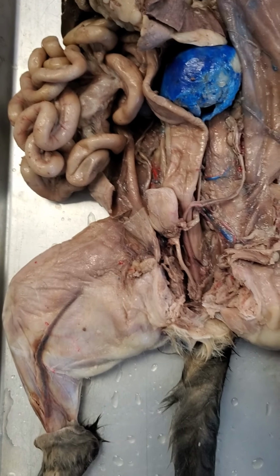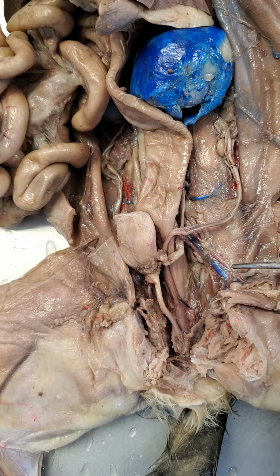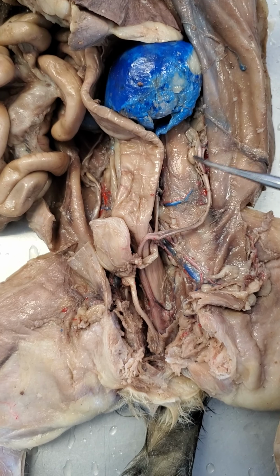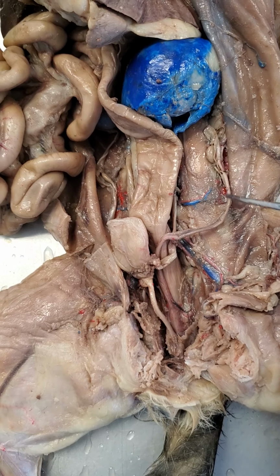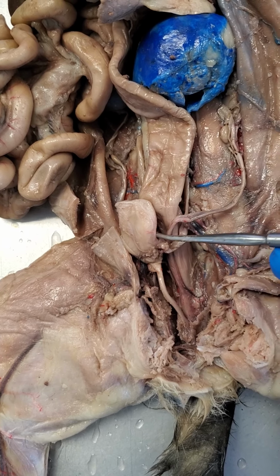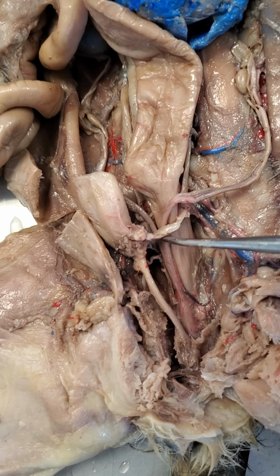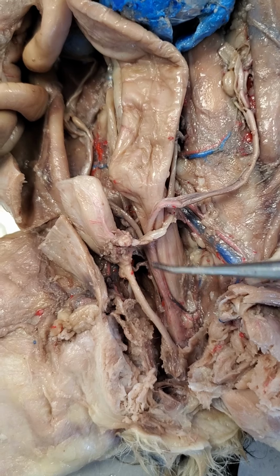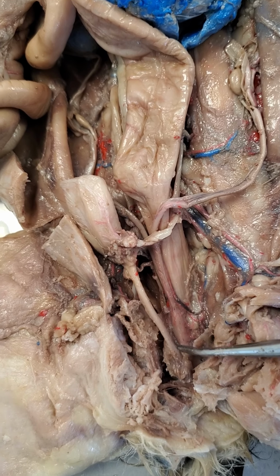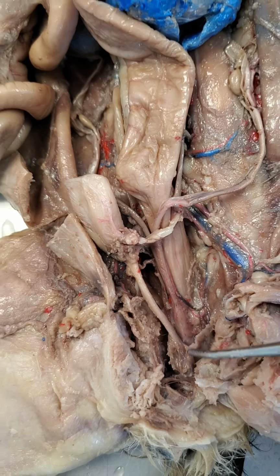All right, so that is basically it for the reproductive structures on the female cat that we would expect you to identify. So again, we have the ovaries, the fallopian tube, the uterine horn, and the same structures on the other side. We have that uterine body where the two uterine horns are coming together. And we have the vaginal tract going down until it merges with the urethra. And then below that, that becomes the urogenital sinus.